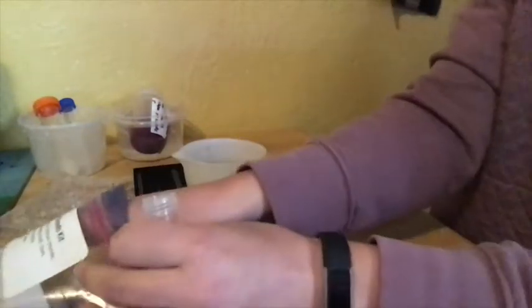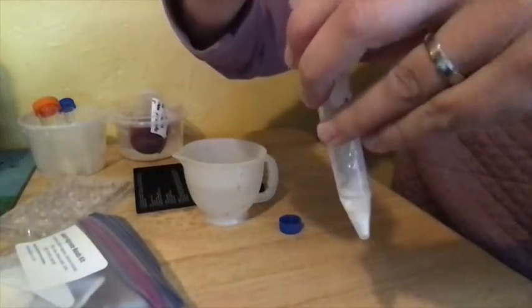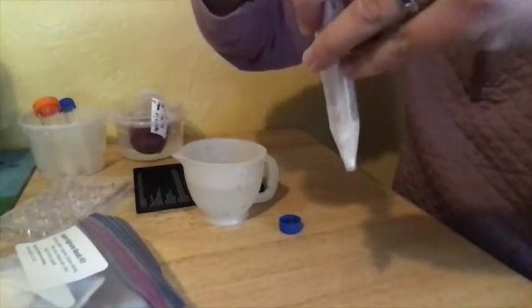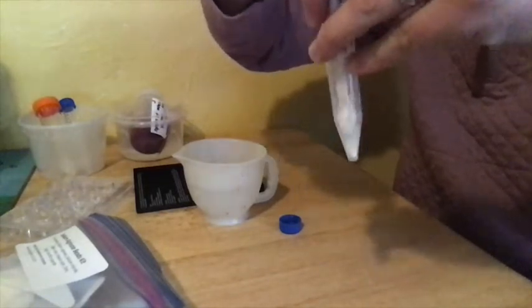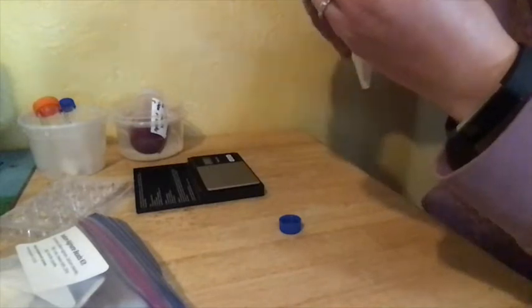Take your wooden stir stick, or if you have a chopstick or something, might be even better, and work on getting it all combined into a thick paste. All right, and then, you're going to fill this up to the 9 milliliter line with just some tap water.